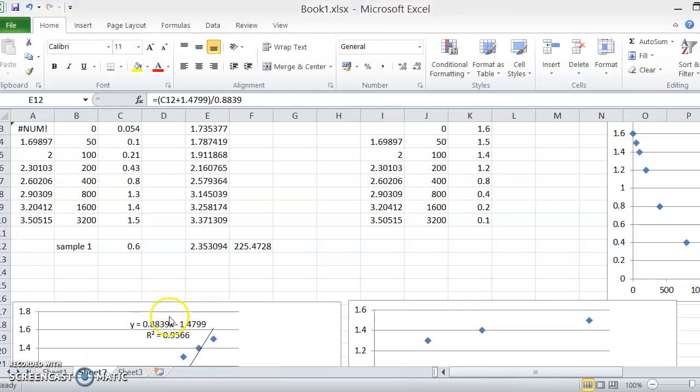Now what we can do is take this formula, rearrange it so that x, which is our nanograms per mil, but a logarithm of it, is on its own. So if we go y, which is our absorbance, plus 1.4799, which is what I put in here. So let's say here's a sample, a patient sample in C12. So C12 plus 1.4799. Rearranging this equation, put brackets around that, divide it by 0.8839, that will mathematically leave x on its own. X is our number that's related to our concentration.